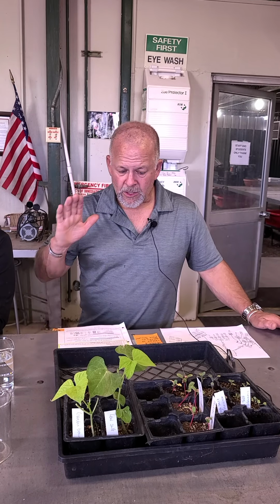So just to remind you what's happening on this one, we have Hoagland's solution, which is a complete nutrient solution for plants when we grow them hydroponically. And remember, growing them hydroponically is growing them without soil. It's not a soil, it's just a liquid solution. And we supply, you'll see this in a second, air to the plants through an air pump so that they can actually grow and they don't just get bogged down, use up all the air in the water. So we have actually got Hoagland's solution over here.